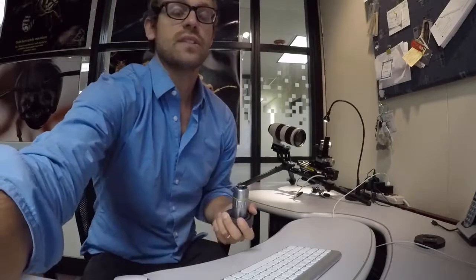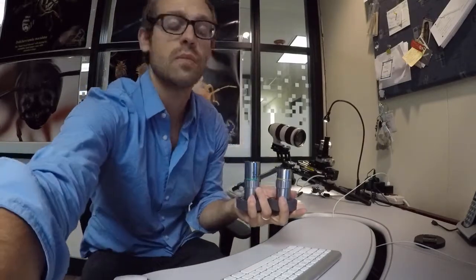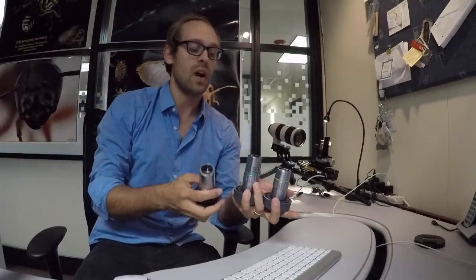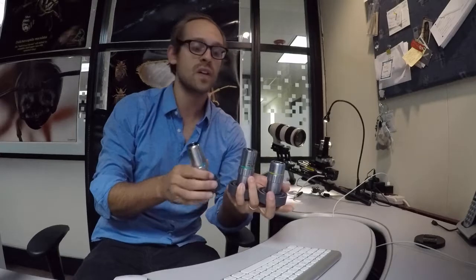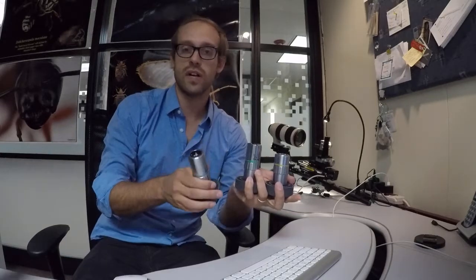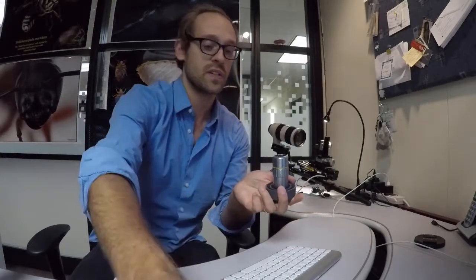I've got a few different objectives here which I'm going to be using to capture images. I'm going to do a 10 to 50x. The 100x is very similar to a 50x, so it's not worth doing a 100x objective as well because a lot of the techniques in the approach is very consistent.